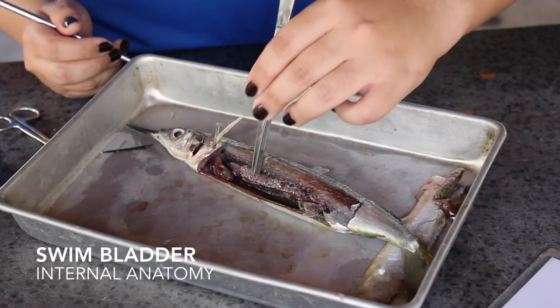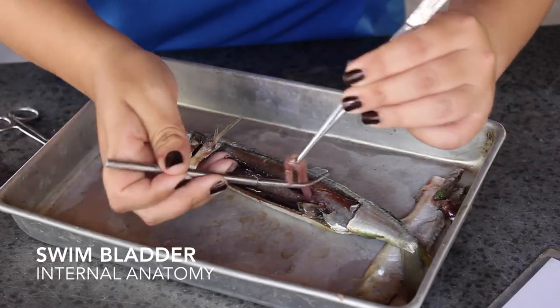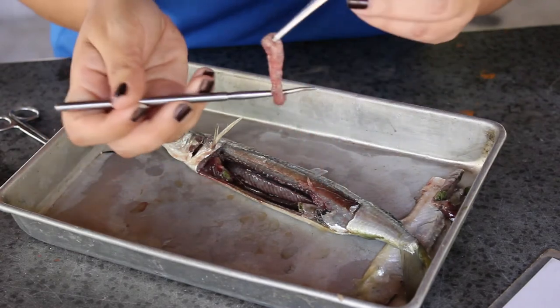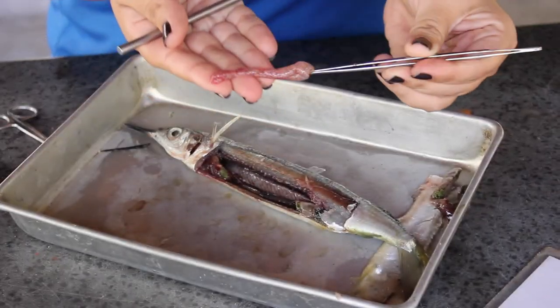Now we are going to remove the swim bladder. You can see that it is a bubble-filled sack. This is actually used for buoyancy.